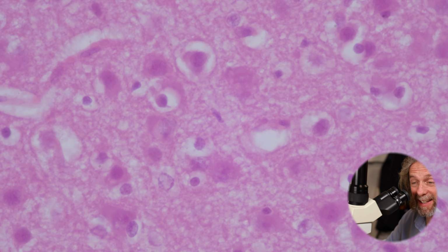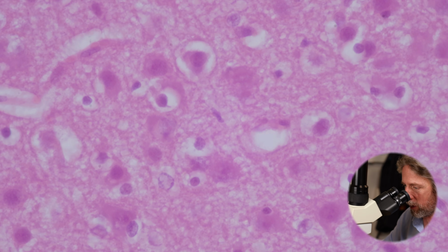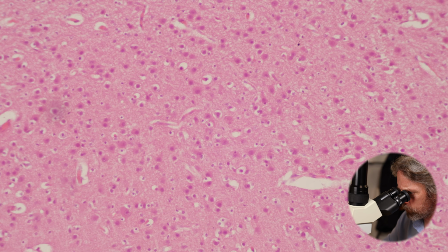Surprisingly, that's it. Is the histology of the cerebrum the simple part of the cerebrum? Oh no, well, that's the grey matter. We still got to do the white matter. But the white matter is the same stuff, it's just going a different way. But you've got your microglial cells, your astrocytes, your oligodendrocytes, and your neurons. So if we zoom out, we are seeing that mix of cells.